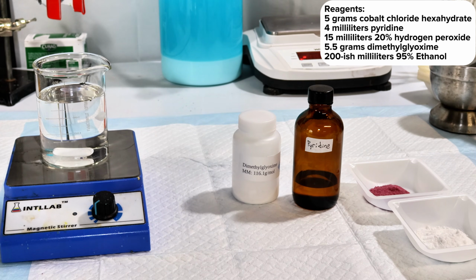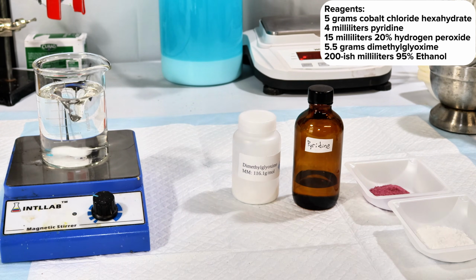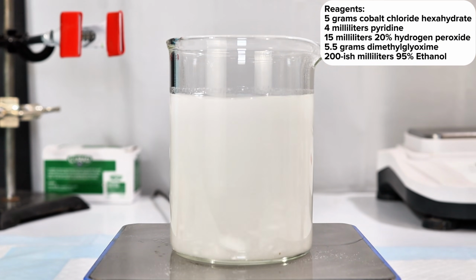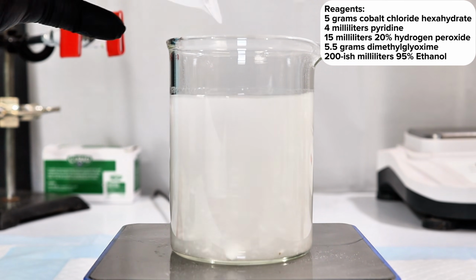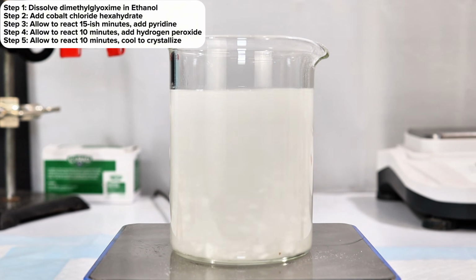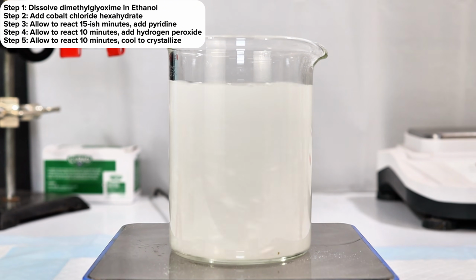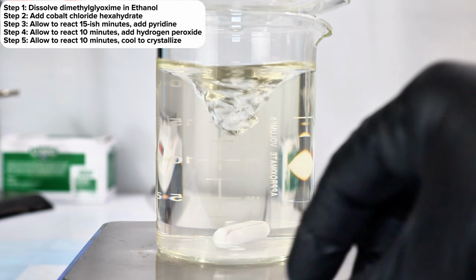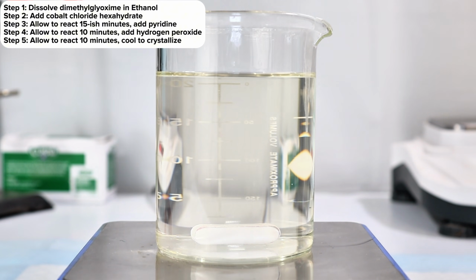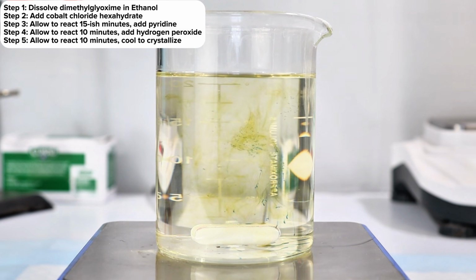To get started, I began by dissolving 5.5 grams of dimethylglyoxime in around 200 milliliters of 95% ethanol. Even in ethanol, this stuff is only sparingly soluble, and so to get it to dissolve completely, I had to give it a minute on my hot plate. Once the dimethylglyoxime had completely dissolved, I again began to slowly add 5 grams of powdered cobalt chloride hexahydrate. The moment the cobalt chloride comes in contact with the ethanolic solution of dimethylglyoxime, it will briefly turn blue before forming a reddish-brown soluble complex.